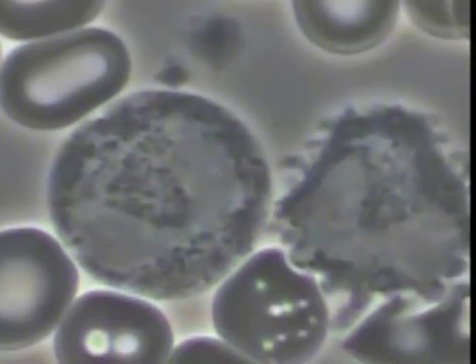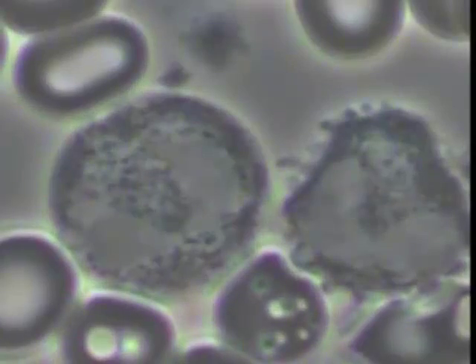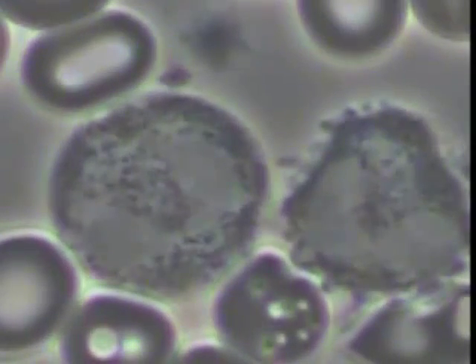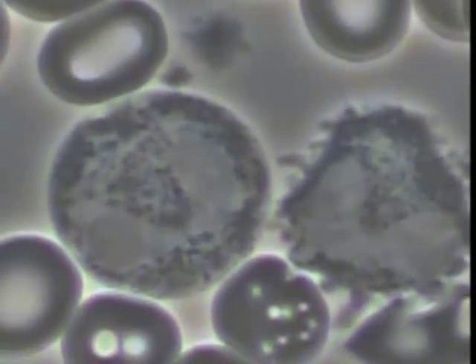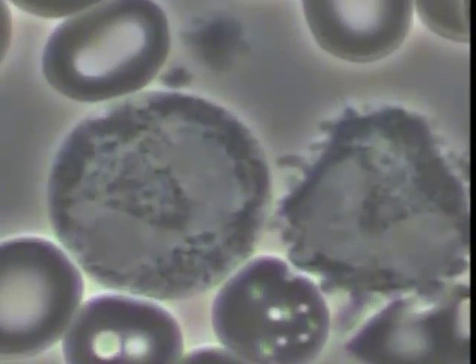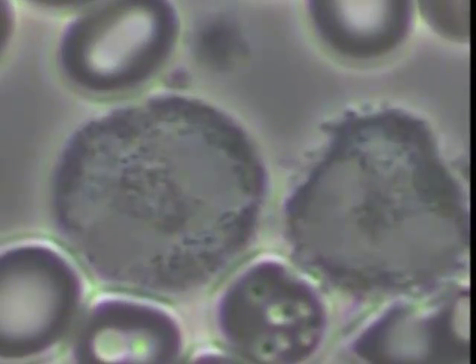Notice the couple of blobs. Now we've zoomed down to take a look at a couple of white blood cells. Notice the ratio of white blood cells to pathogenic cells.